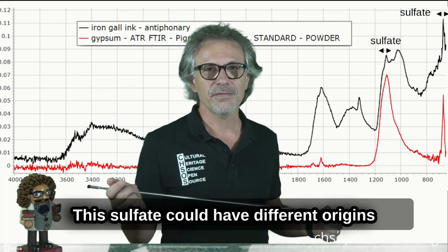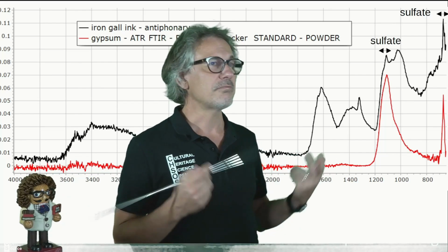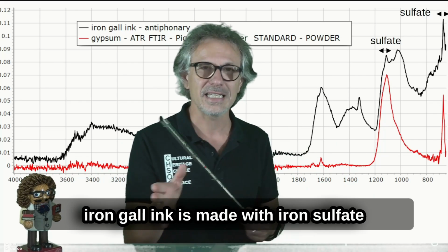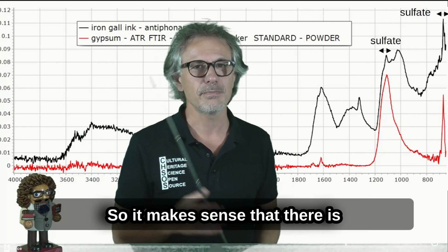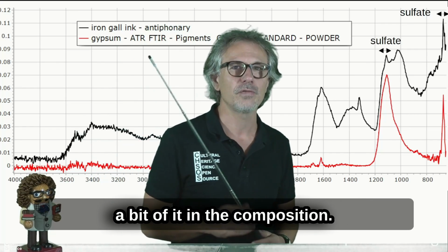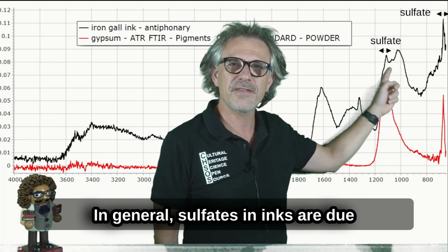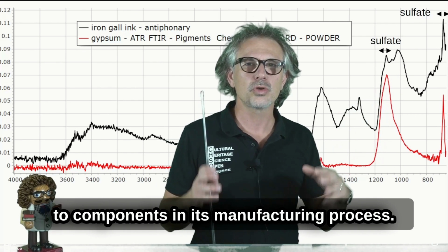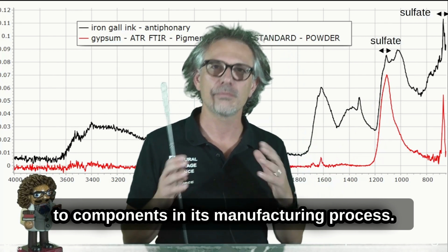This sulfate could have a different origin. We could consider, first of all, that iron gall ink is made with iron sulfate, so it makes sense that there is a bit of it in the composition. In general, sulfates in inks are due to components in its manufacturing process.